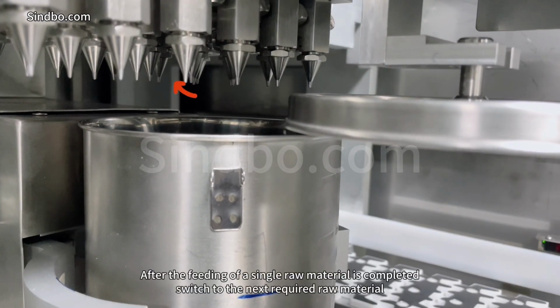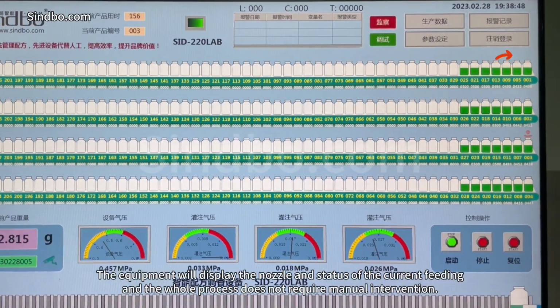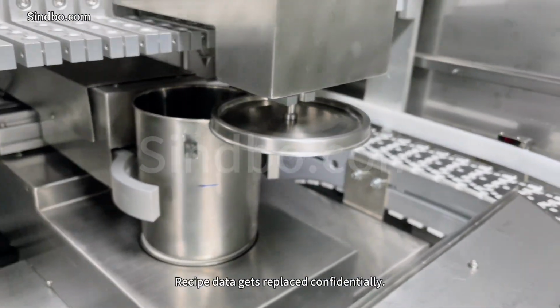After the feeding of a single raw material is completed, switch to the next required raw material. The equipment will display the nozzle and status of the current feeding, and the whole process does not require manual intervention. Recipe data gets replaced confidentially.